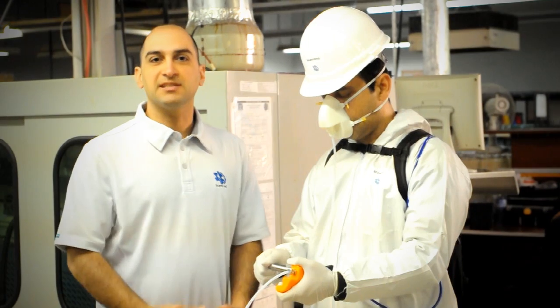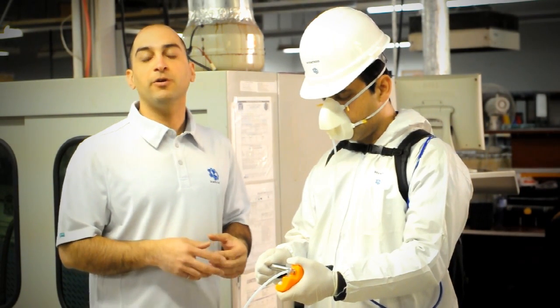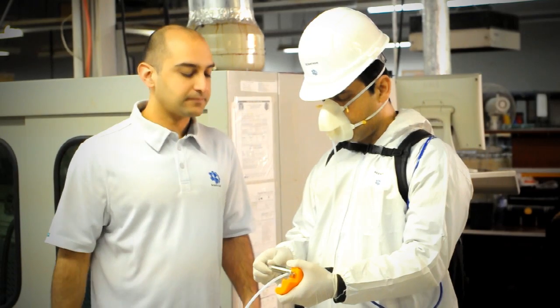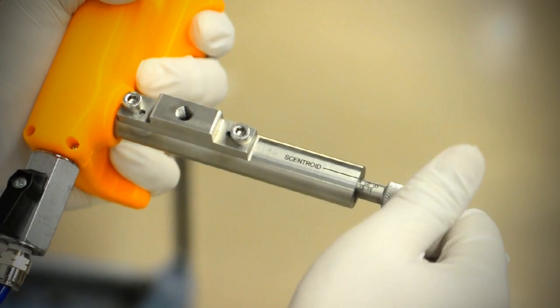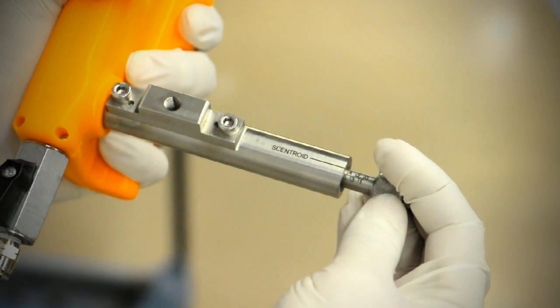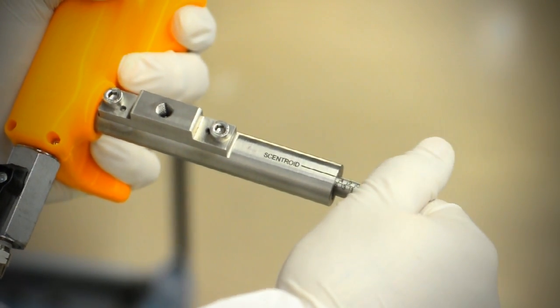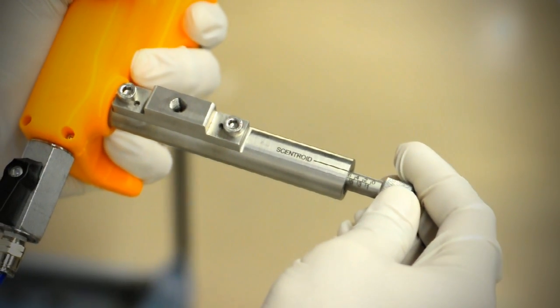So for the sake of the video let's assume that 30 seconds has passed. Now he's going to start by opening up the valve. Taking one step, step one, going quickly between the numbers but stopping at each one for about five seconds. He's going to stop when he smells the faint odor of resin.